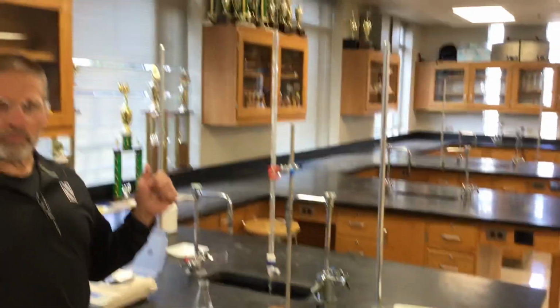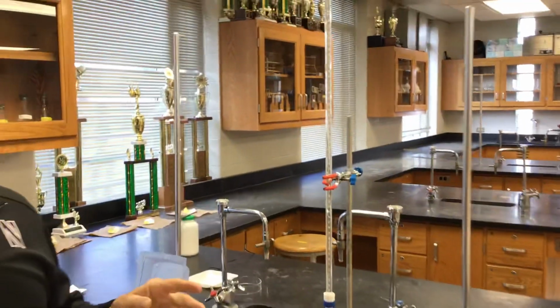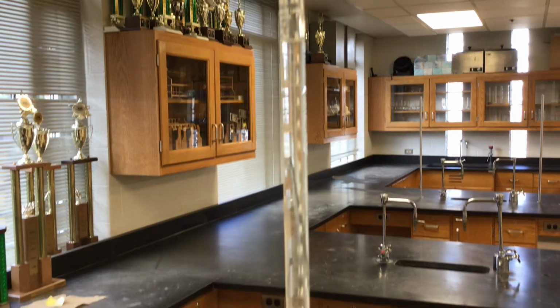Because last spring was so disrupted, you probably never had a chance to do a process called titration and to use a device called a burette. It's a very standard technique in any chemistry lab. If you have a dry sample, you can put it on the scale, get the mass, change the mass to moles, and calculate anything you want. But if something's dissolved in water, it's got to be a different process.